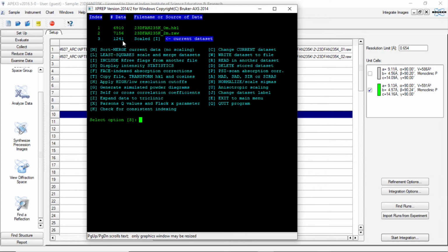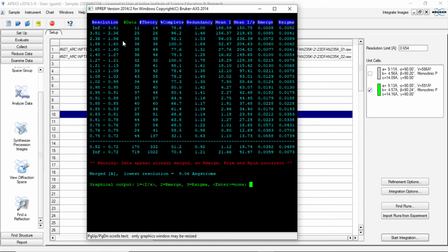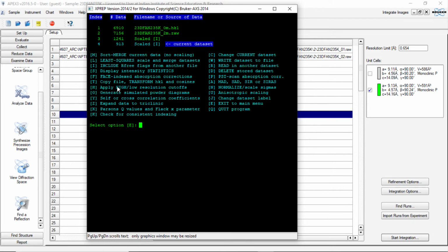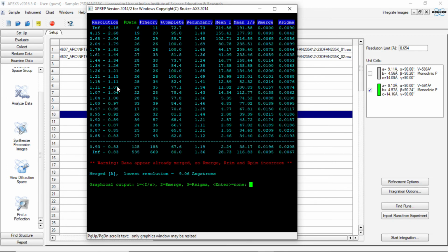So now if I do an intensity statistics, still we see the overall completeness up to 0.72 is very less. We try to cut this data in resolution of 0.84 or maybe 0.83. And see what happens. See, up to 0.83, the completeness is about 80%, which is not that bad.